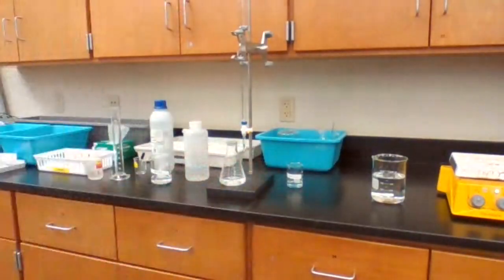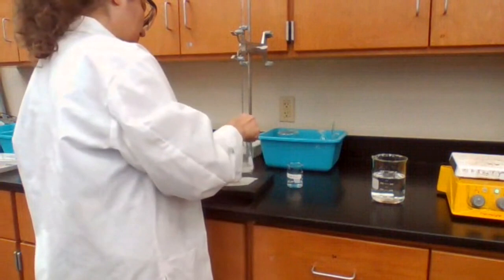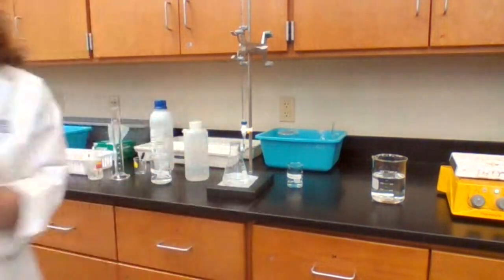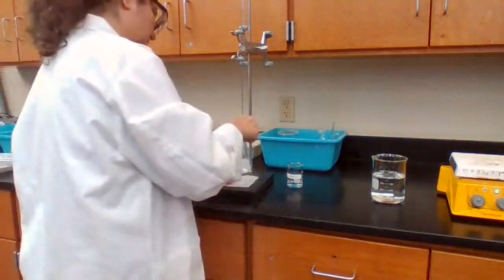Leave a white sheet of paper to be able to see the color. Make sure that your data sheet is not missing anything.